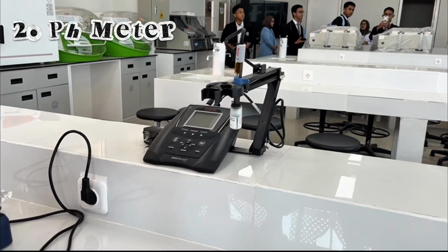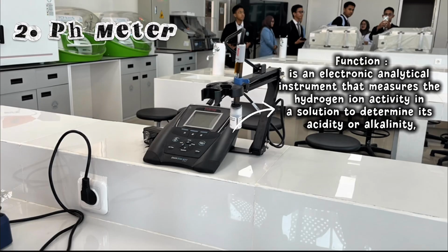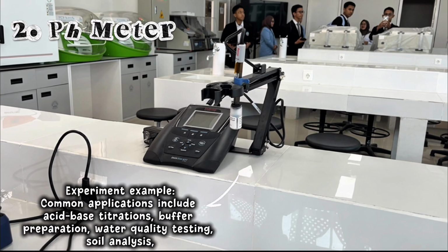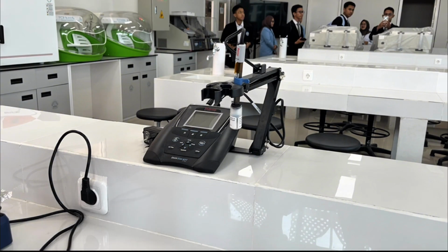The next one is the pH meter. It is an electronic analytical instrument that measures the hydrogen ion activity in a solution to determine its acidity or alkalinity. Example experiments using this equipment include acid-base titration, buffer preparation, water quality testing, and also soil analysis.